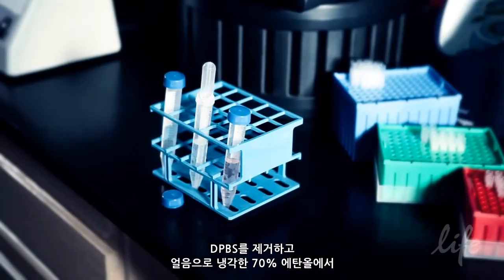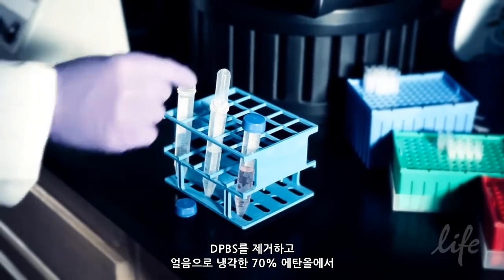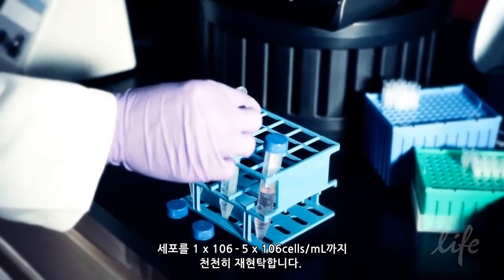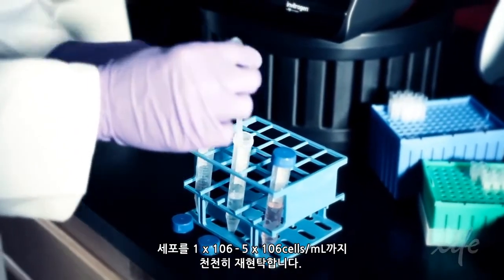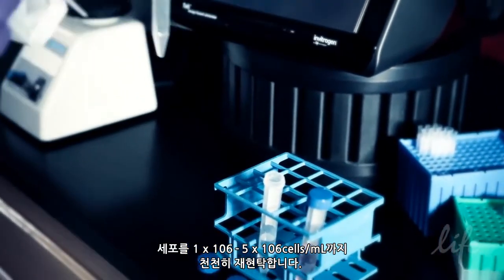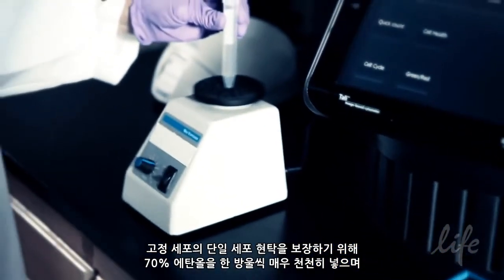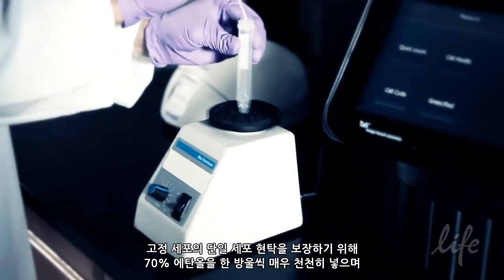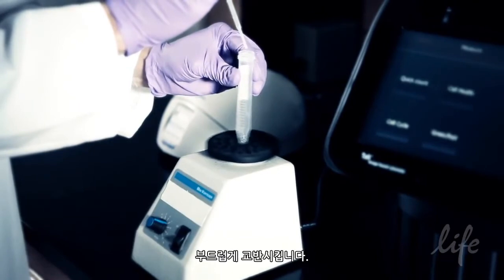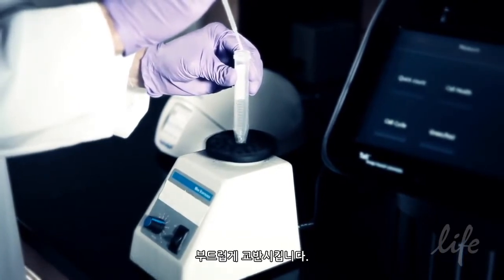Remove the DPBS and slowly re-suspend cells in ice-cold 70% ethanol to 1 million to 5 million cells per milliliter. To ensure single cell suspension of fixed cells, begin adding 70% ethanol very slowly, drop-wise, while gently vortexing.